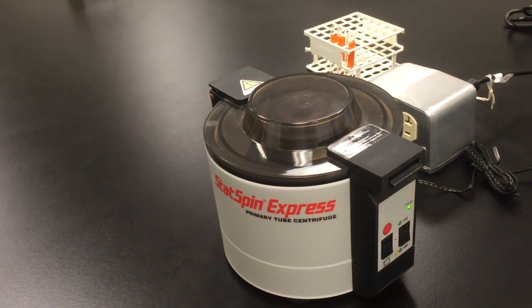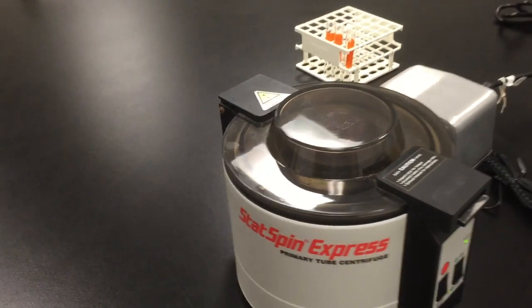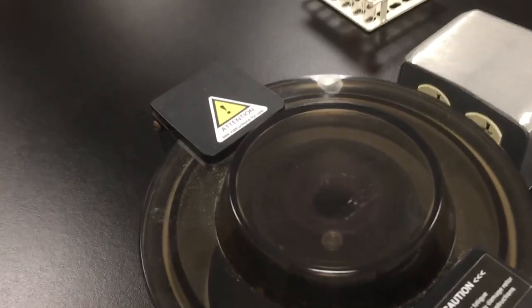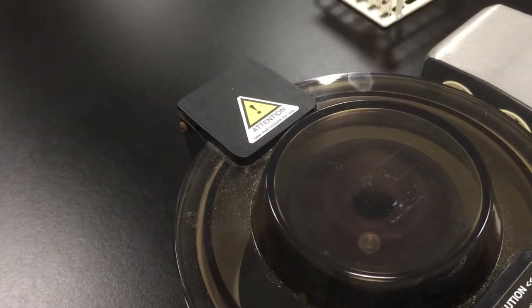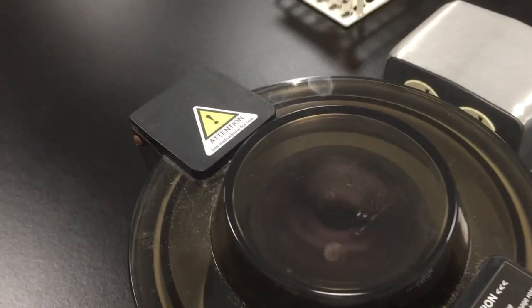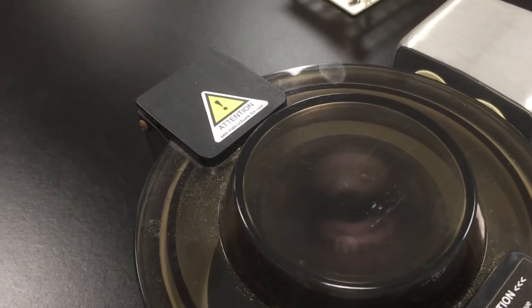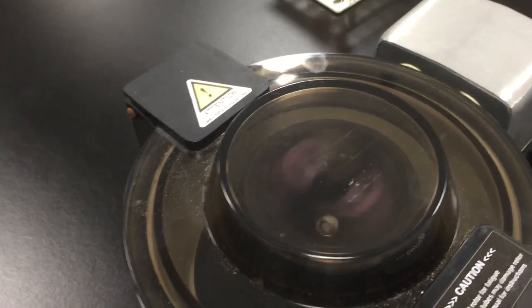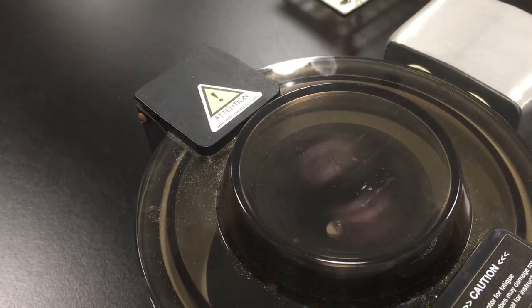Okay, we are going to stop it. You have to wait for it to come to a complete stop for safety reasons. And it is slowing down.